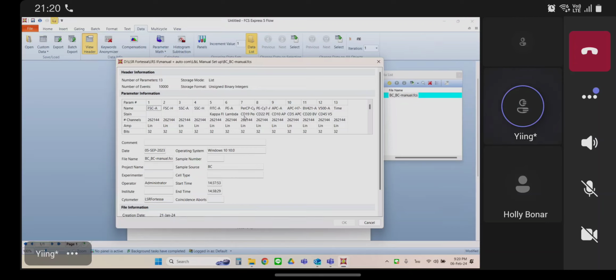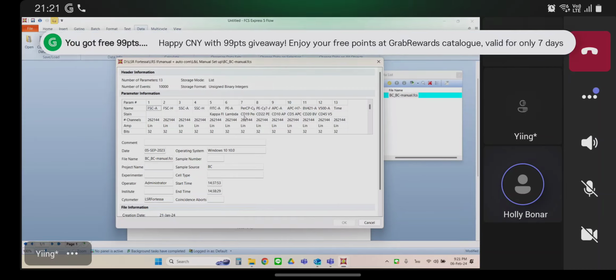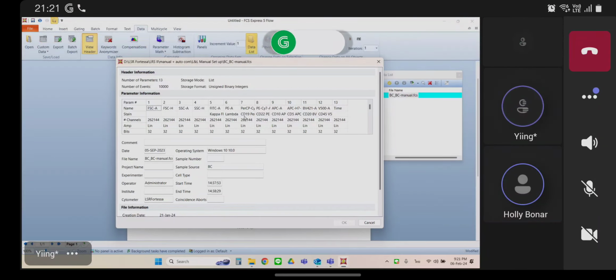What should I do for the fixed parameter? Well, you have a couple of options. If you have this data, like for this particular data file, you could go back to the instrument and re-export it so that it exports the width parameters too, so that you have a new data set. You can always adjust the layout, but you're not going to want to adjust the layout all the time, right? You want to always export your data files with the same number of parameters every time going forward.